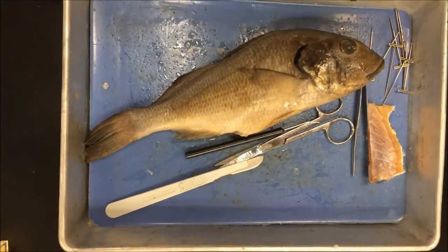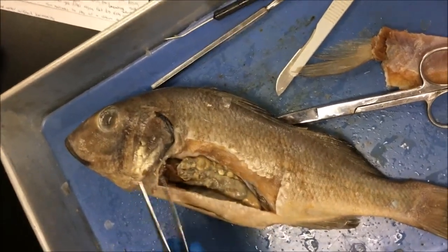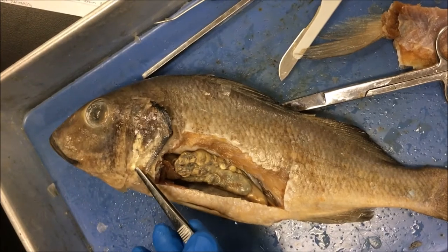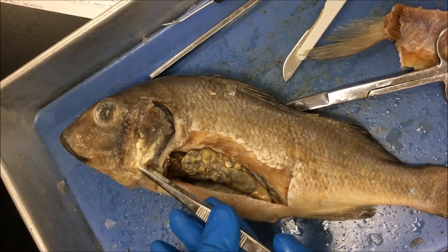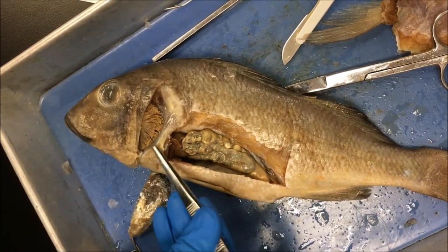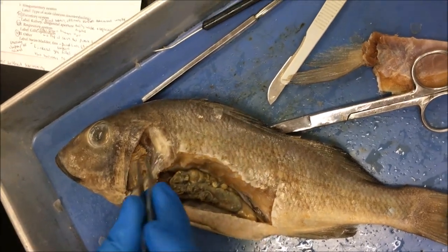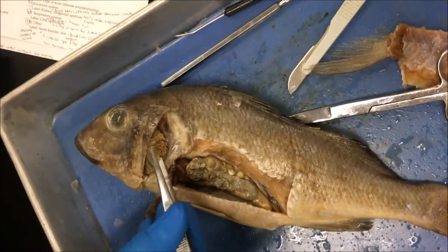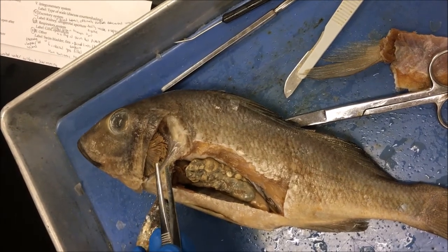We're going to start with the gills and operculum. The respiratory system of the perch consists of the gills and the operculum. The operculum is a hard flap of skin that protects the gills from the outside environment. By moving the operculum, the fish can move oxygen and water without swimming. Water can either go through the mouth or straight to the gills, and the gill filaments have a feathered texture that increases the surface area for oxygen absorption, which is then transported through the gills into the body by a series of small capillaries.